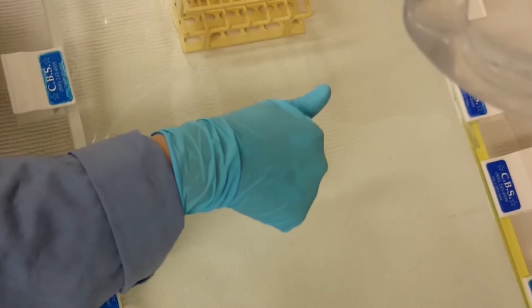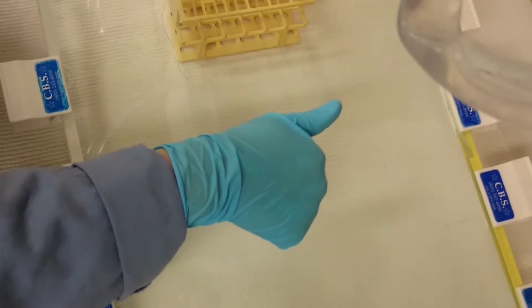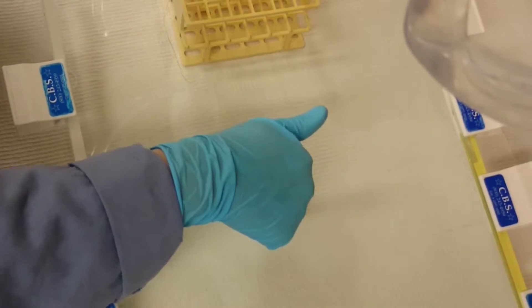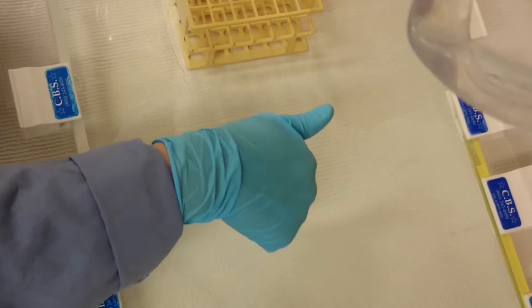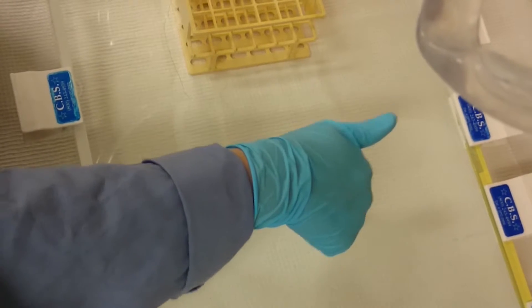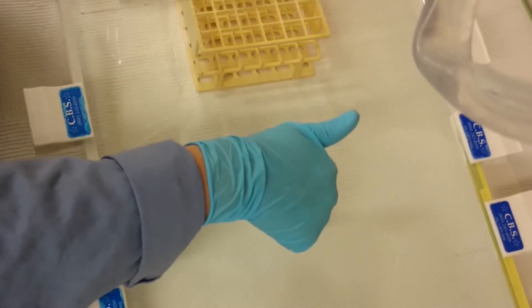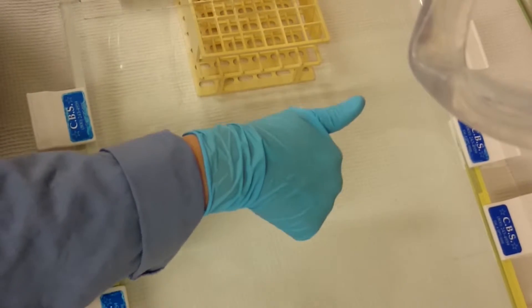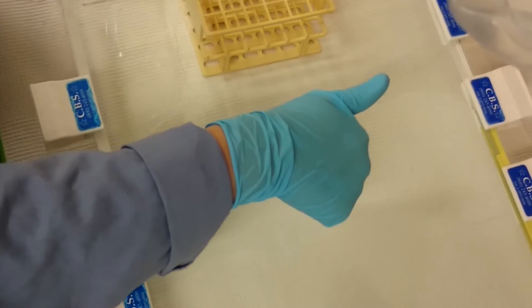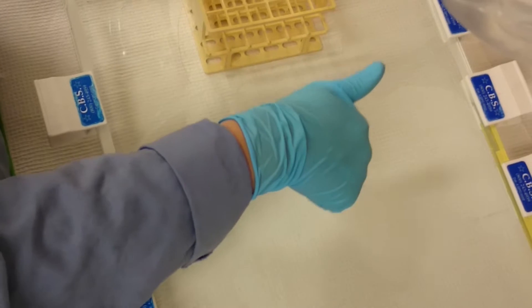So just a couple things that I've found go a long way toward getting better resolution with the gels. So I've certainly found that filtering the gel solution helps, both in terms of getting better resolution and in terms of avoiding your sample getting hung up on particulate matter in the gel and just smearing out the rest of the time while it runs.